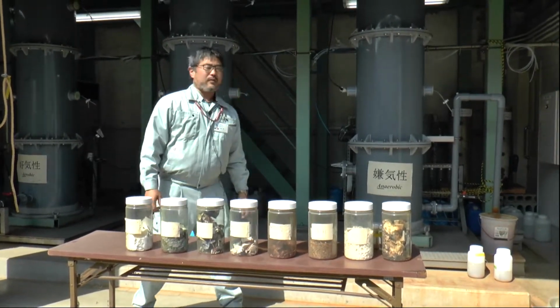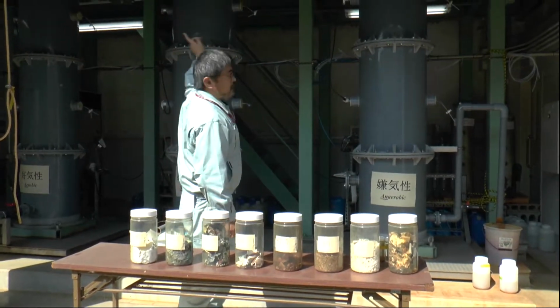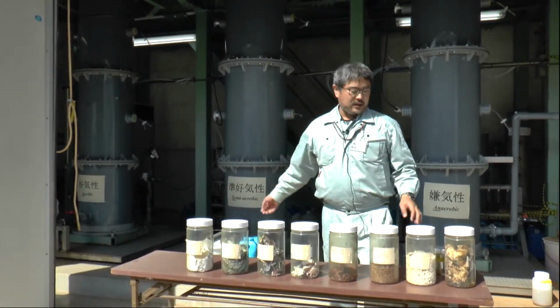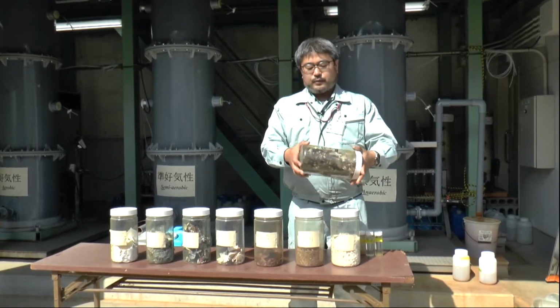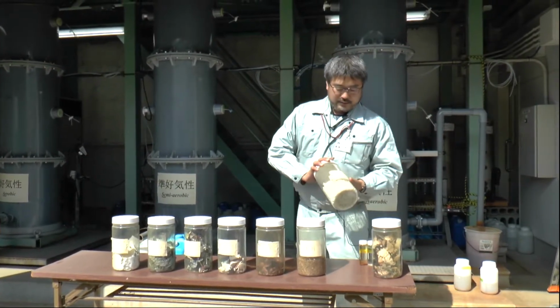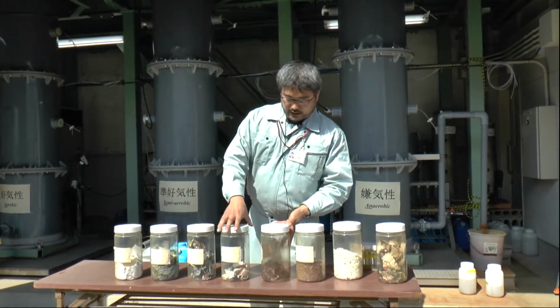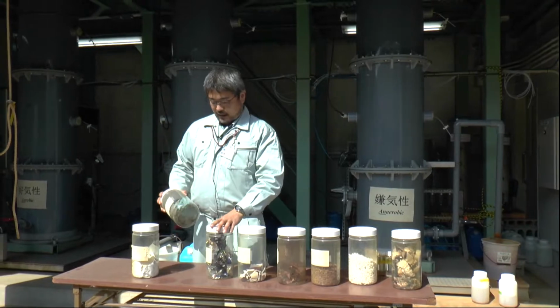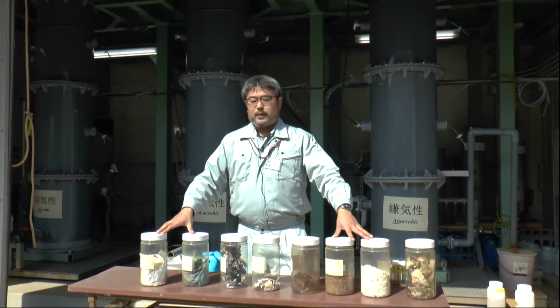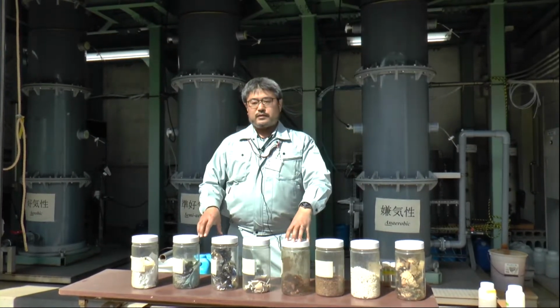Hi. Okay, now I will explain about our landfill simulator. Here we prepared 3 large simulators for the real landfill site. Inside of this simulator, we put the artificial waste component, controlled waste. Inside we have pulp and wood chips and food waste and ceramics, metals and plastics and also used paper. So we prepared all this material and put it inside in 2006.